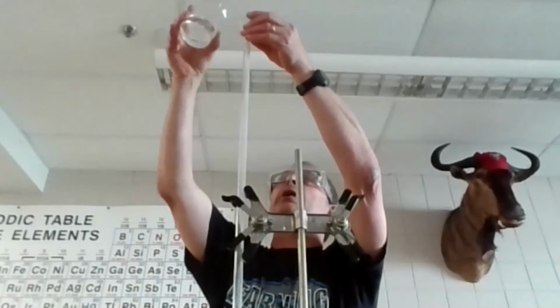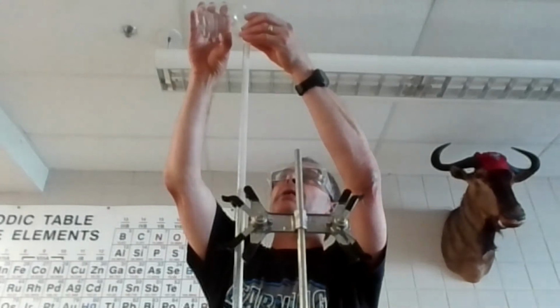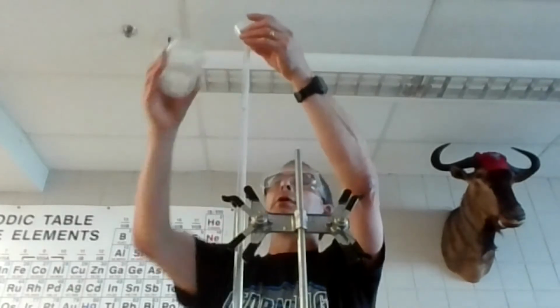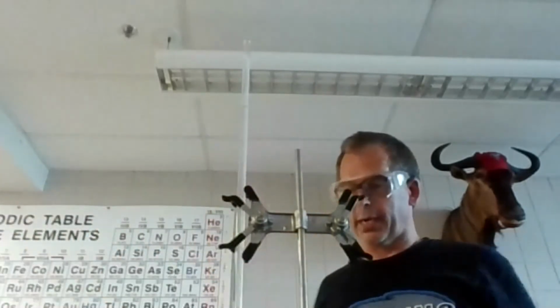Sometimes it's a little tricky and it likes to leak out, depending on the size of the funnel. So just kind of hold it away, hold it above. So hold the funnel above so there's a little air space so that the air can escape as you add the liquid. So I'm going to fill that mostly up. Okay, I think that's pretty good. Let that drain back down. I like to take the funnel out with that, and it's right about right here.